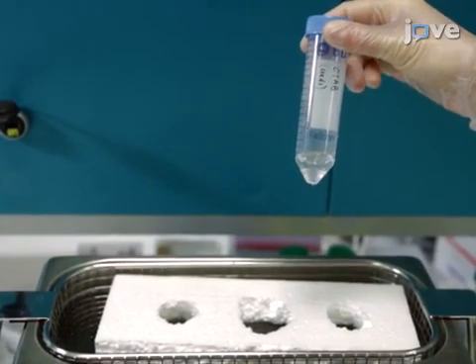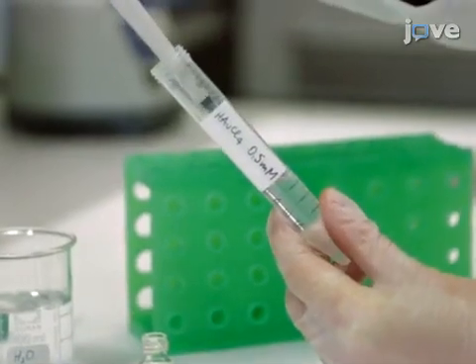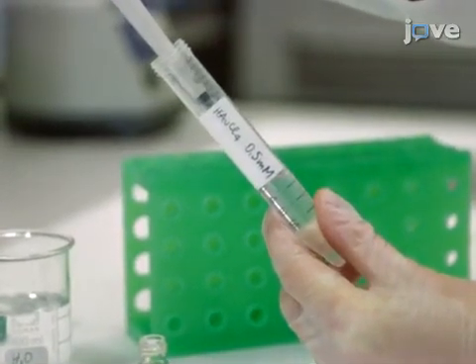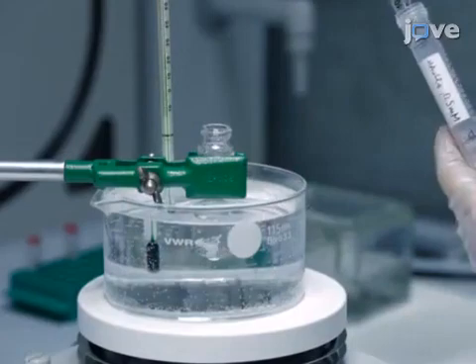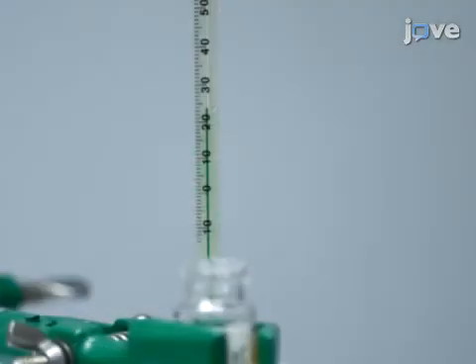Next, prepare 5 milliliters of a 0.5 millimolar solution of tetrachloroauric acid in water and add it to the vigorously stirring CTAB solution at a constant temperature of 27 degrees Celsius.